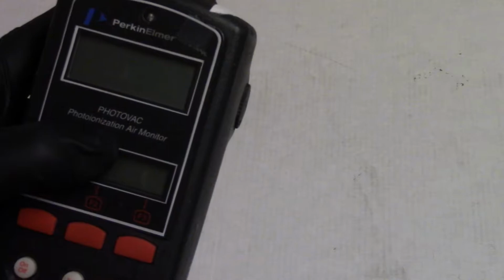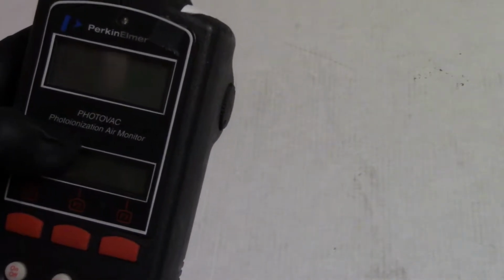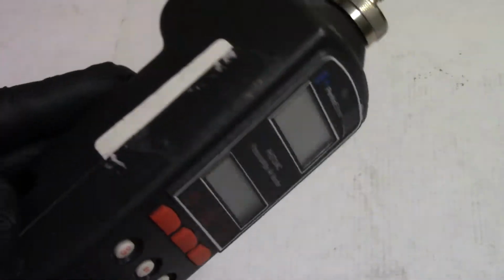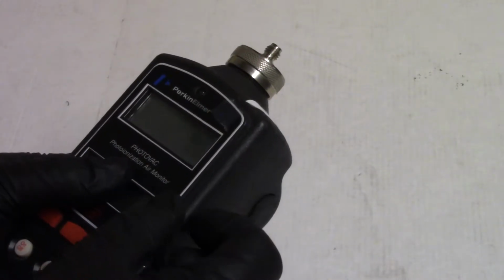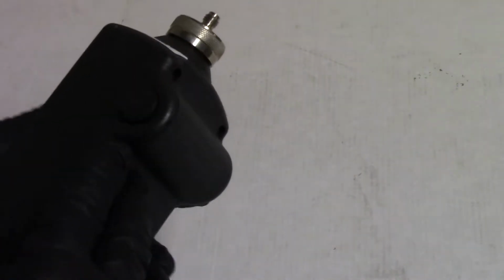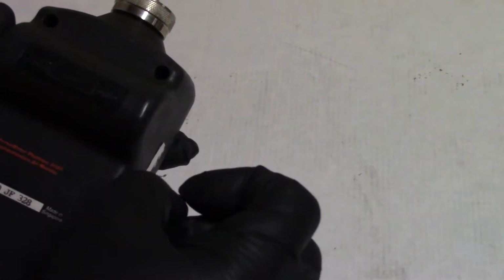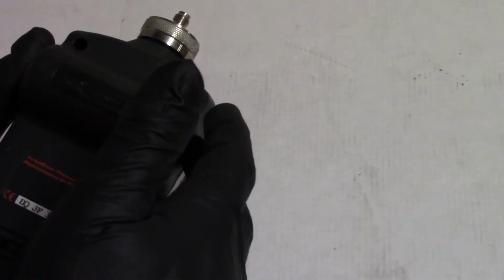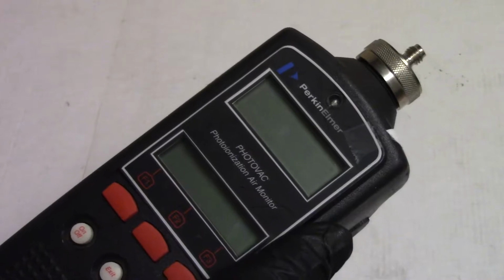PID stands for photoionization detector, or photoion detector, depending on where you read on the internet. But that's what it's doing. It sucks the air across the plates. The sample changes its conductivity depending on how much is in that, because of the UV light. The UV light makes that happen, and then it measures it and displays it on the screen.